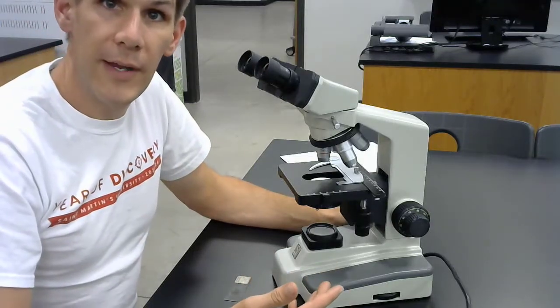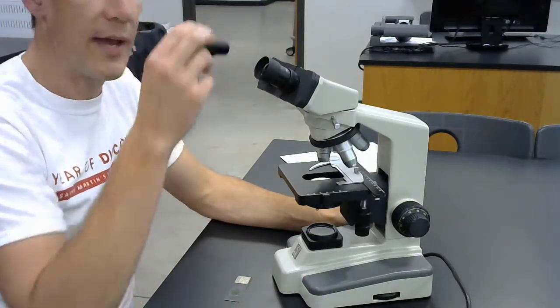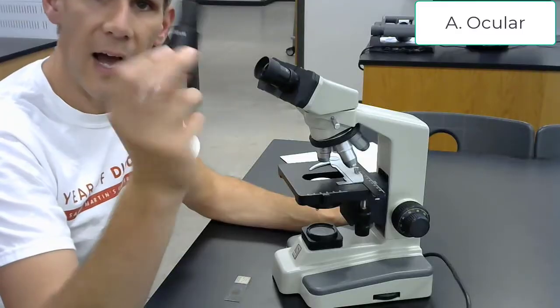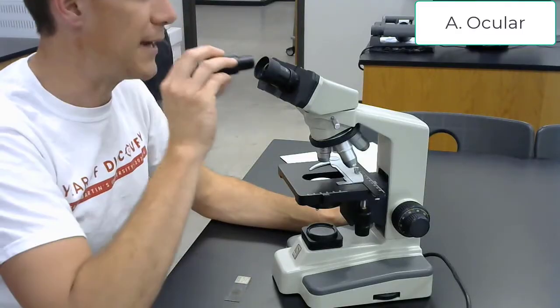Hello, and today we're going to be looking at the microscope. Up here we have the ocular, which is the eyepiece, and this is a 10x magnification.